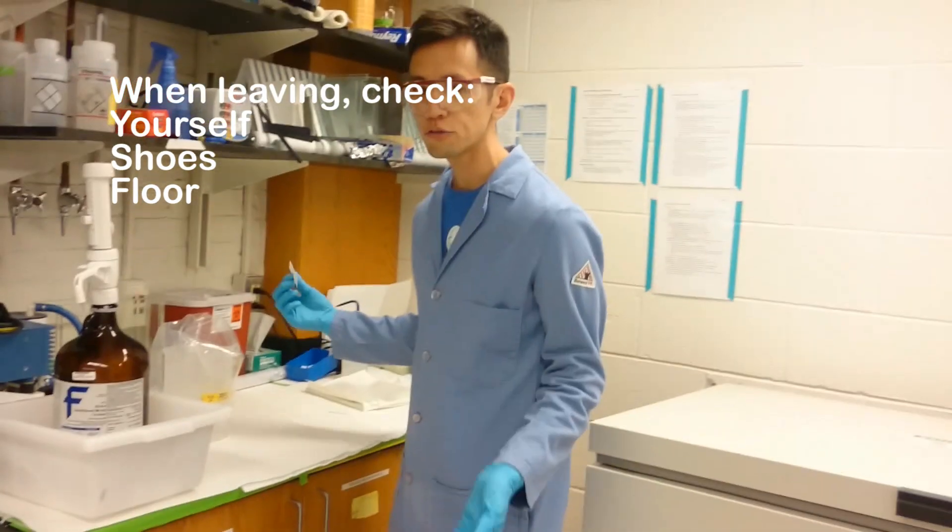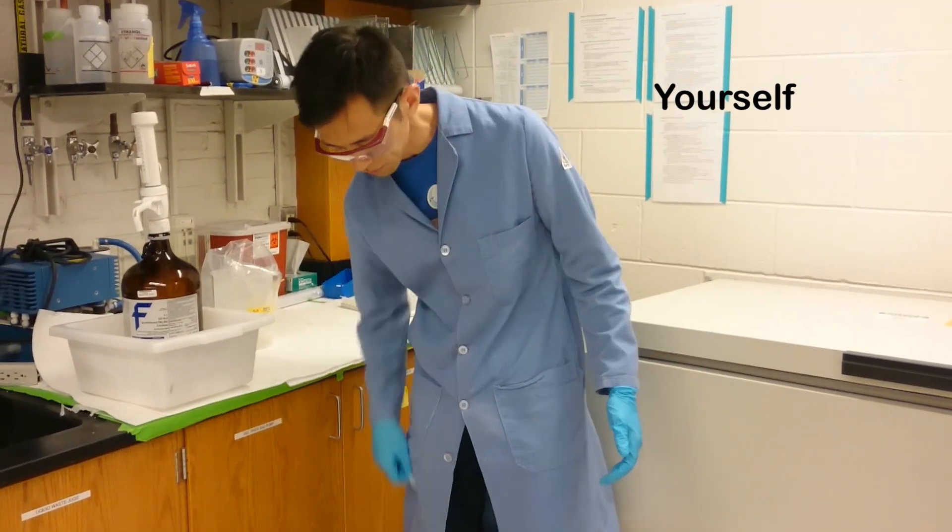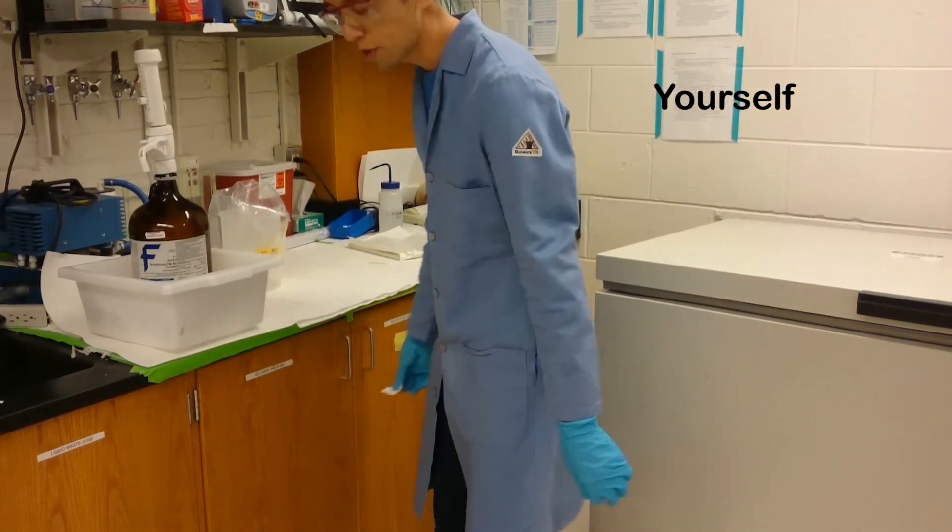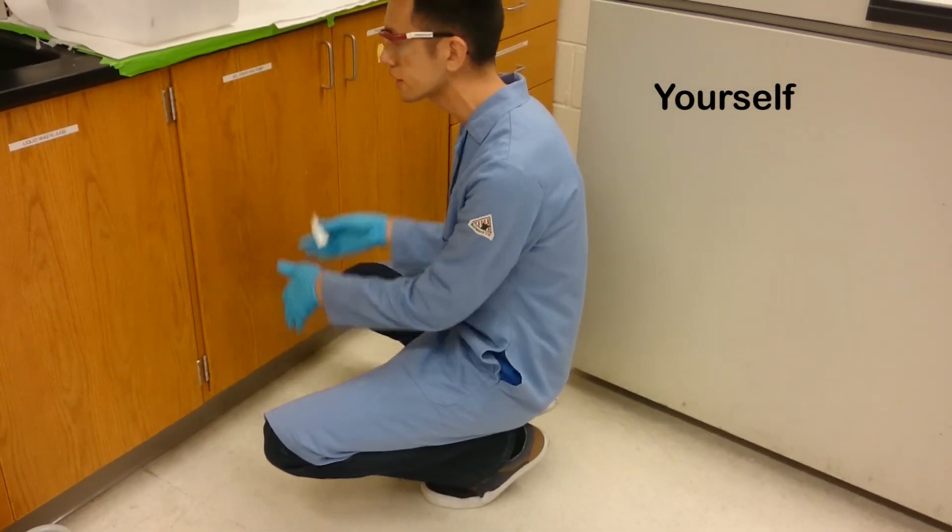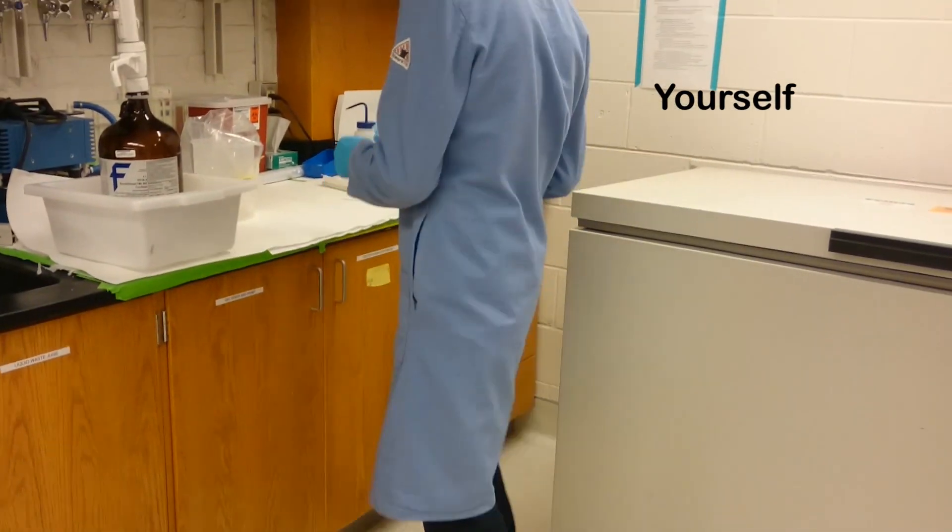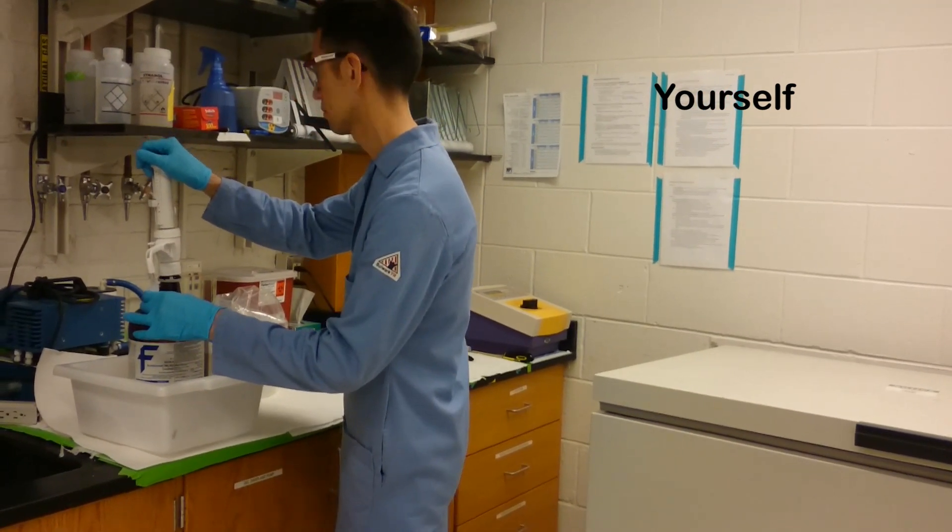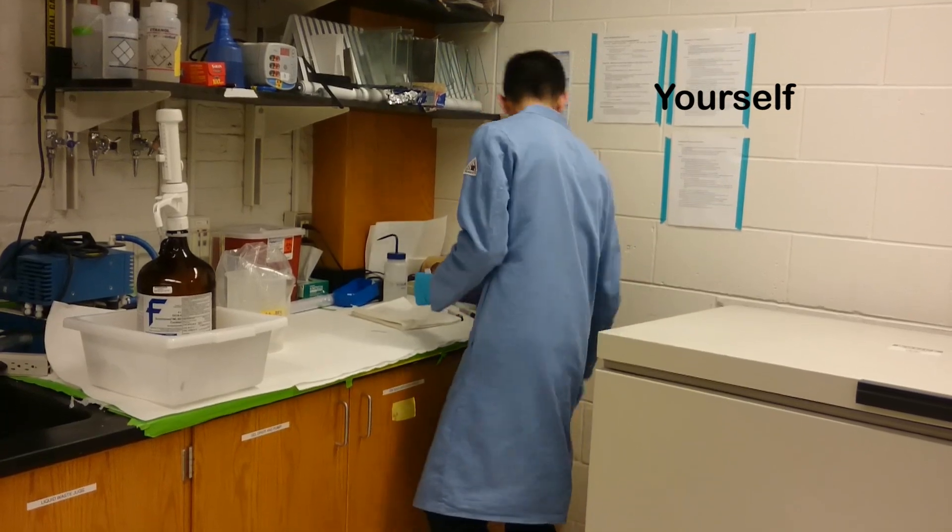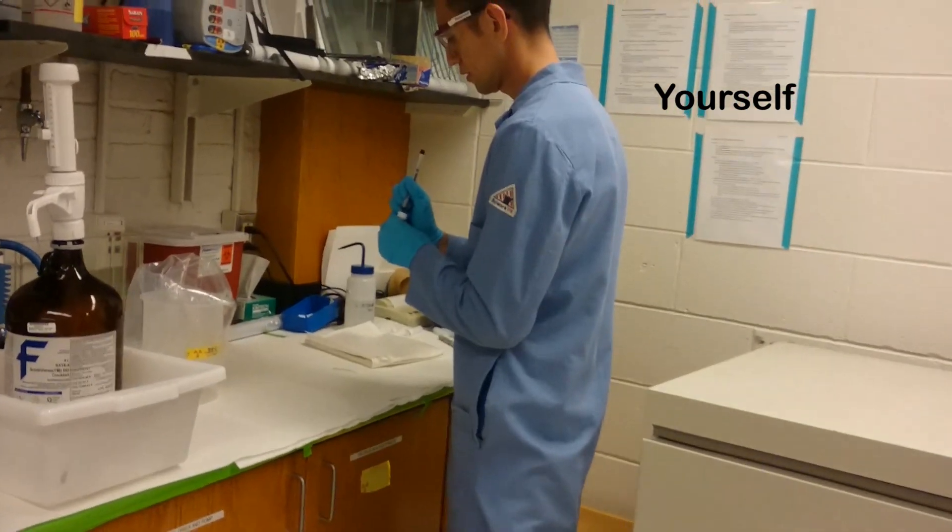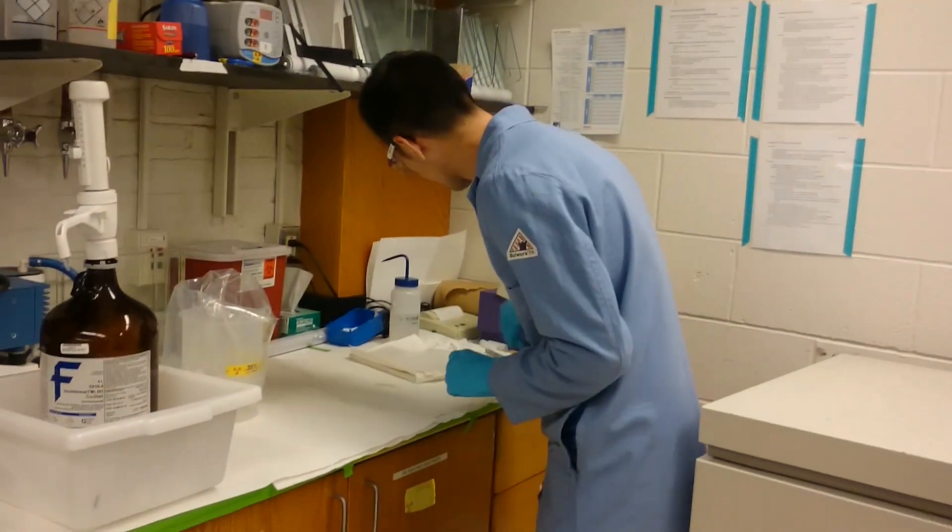I'm going to start by checking myself, starting with my lab coat - the front of my lab coat, the sleeves. We also do a lot of reaching down to pick stuff up and then standing up again, so I'll also do the back of my lab coat.